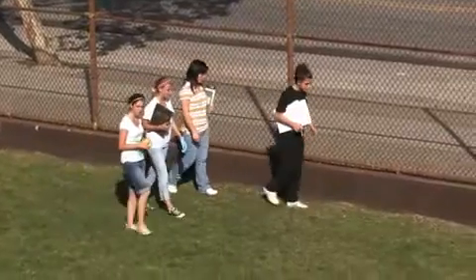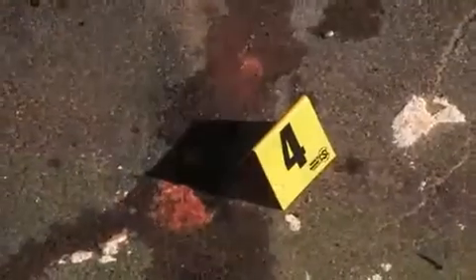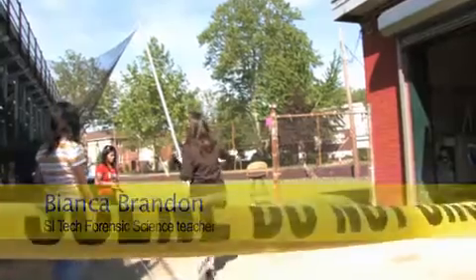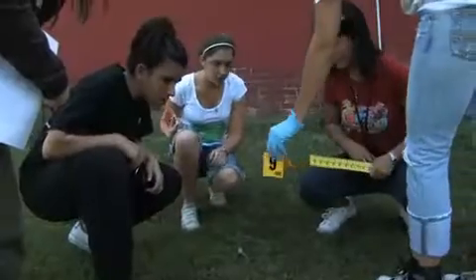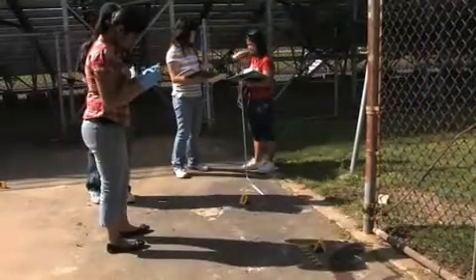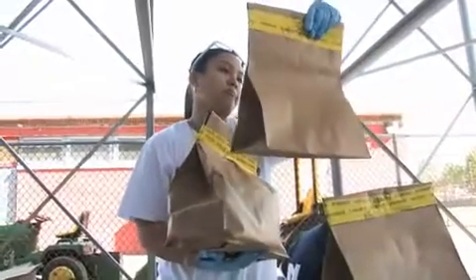This is the forensic science class at Staten Island Tech. They're working on their final exam, which is a practical assessment. A crime scene has been set up for them, and what they have to do is process the crime scene, collect evidence, and compare evidence to samples collected from suspects.